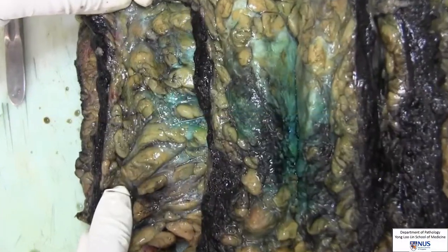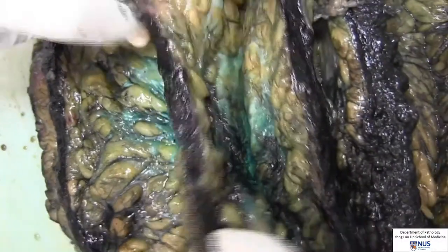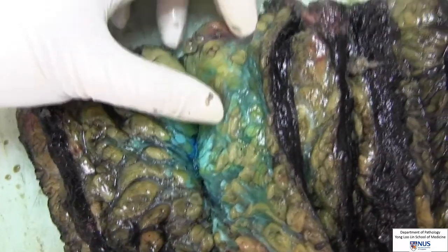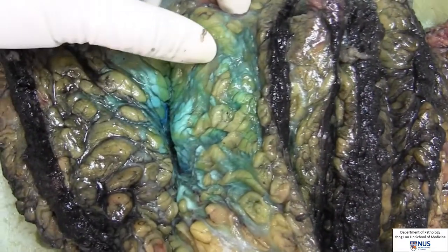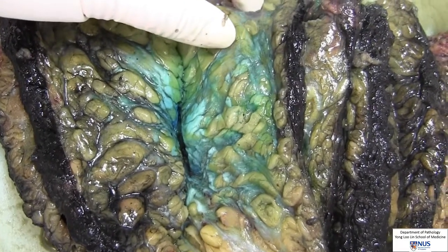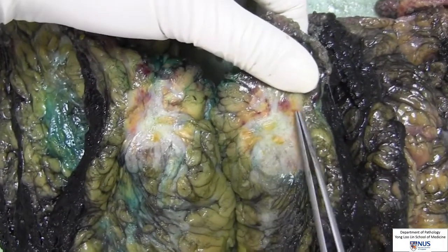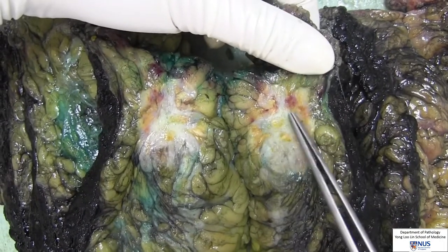Inspecting the breast slices, areas of fibrosis can be identified, suggesting fibrocystic change. The tumour is a whitish, irregular mass, infiltrating the surrounding fat.